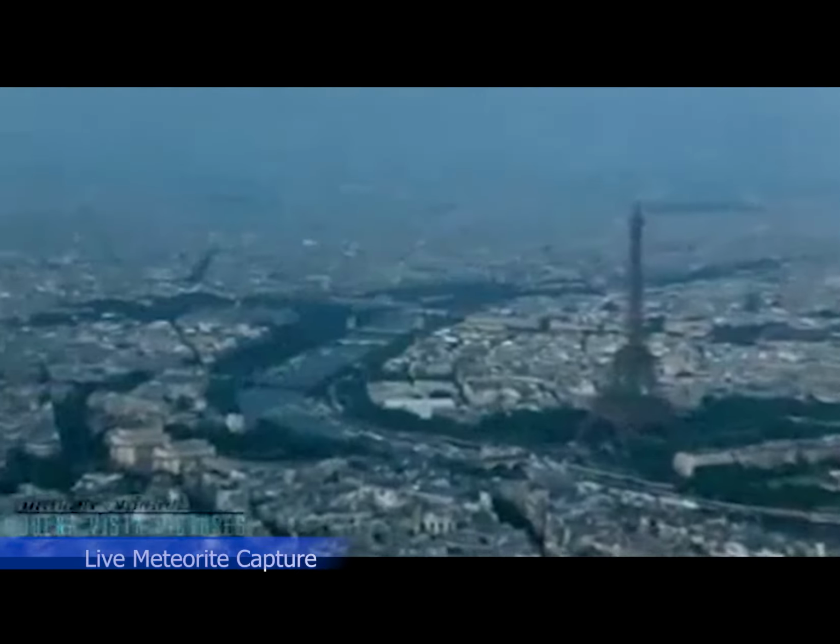Today I'm going to be talking about scanning electron microscopes and how they're used to produce those high magnification images that you see in all the scientific publications. We are going to learn about this instrument by looking at a piece of rock from outer space. That's right, I actually got my hands on a genuine piece of meteorite here from our collection at Macquarie University. I'm not quite sure which meteorite it is, but I was told that quite a few people got injured trying to acquire this specimen.